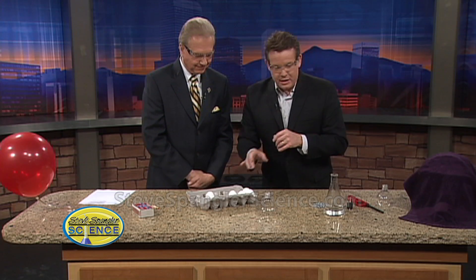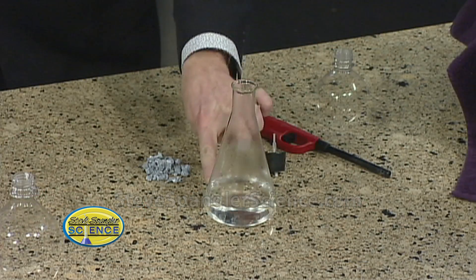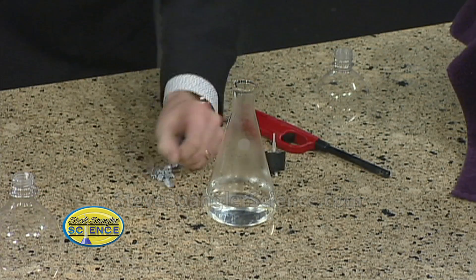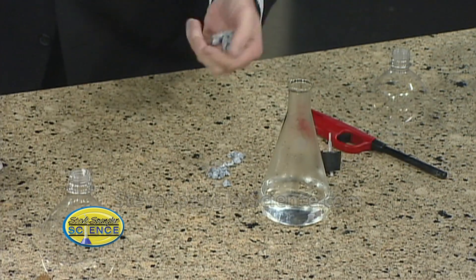So we need that, and we're also going to need hydrogen gas, which you make yourself. I had no idea you made your own hydrogen. Well, you can. So we have an acid down here and I have zinc. Does the auto industry know that this is this simple? Someone needs to call them.